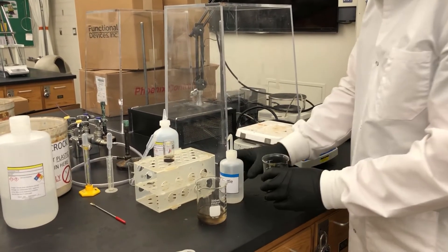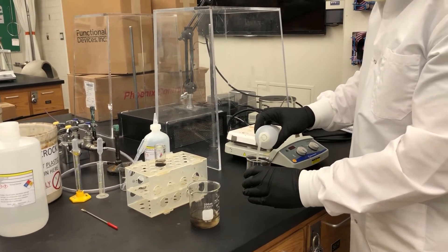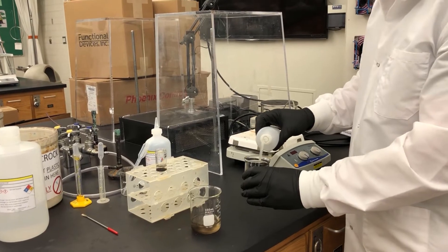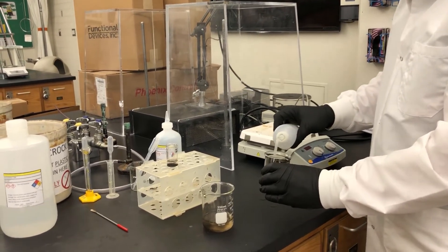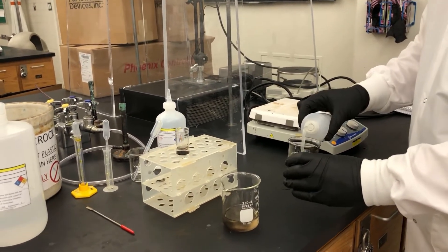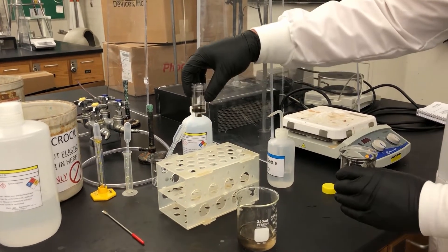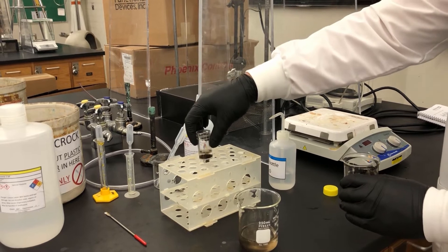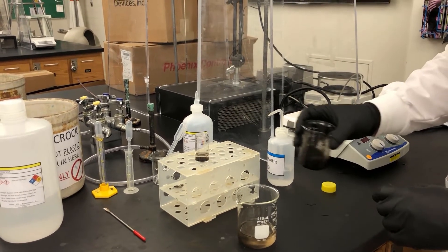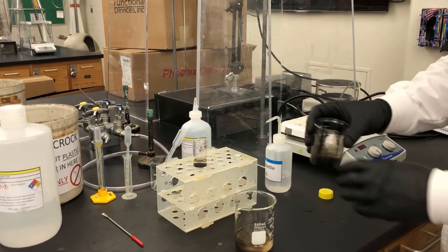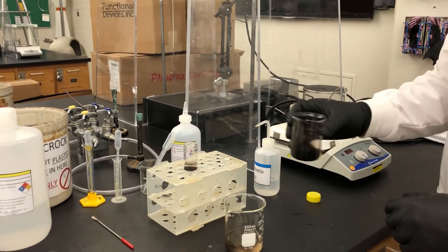Okay. So I'm going to do this maybe one or two or three more times to get as much of the nanoparticles out of here as I can and transfer them over. I'm probably going to end up decanting the water or any other solution that's in here. So we get just pure nanoparticles and that's what we'll be doing for the next few minutes.